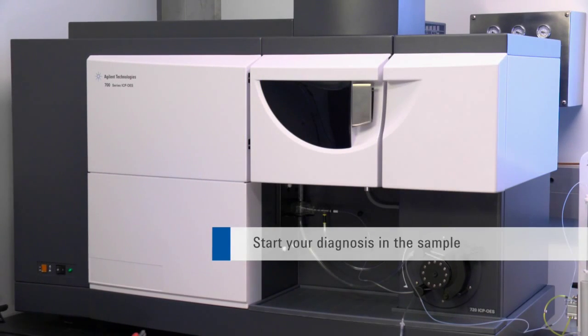Most instrument failures occur in the sample introduction area, so that's where you should start your problem diagnosis. Setting up some routine or preventative maintenance procedures can prevent problems occurring in the first place.